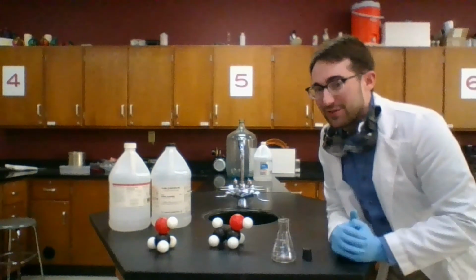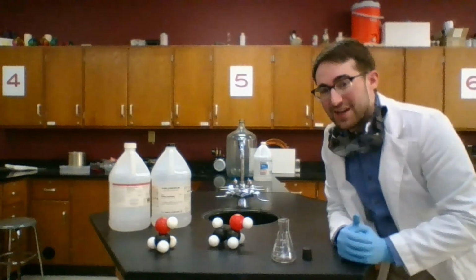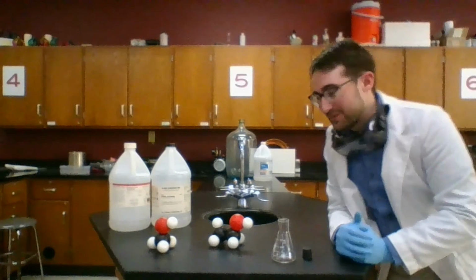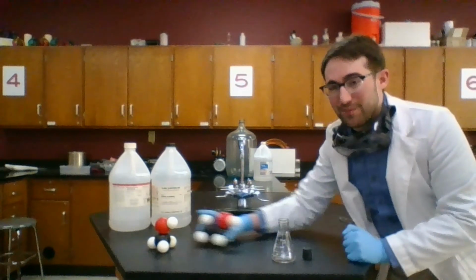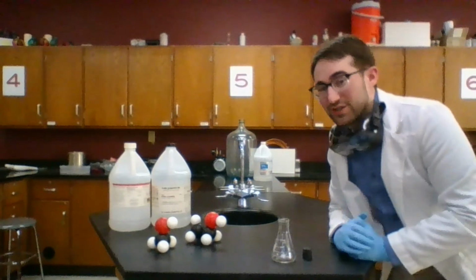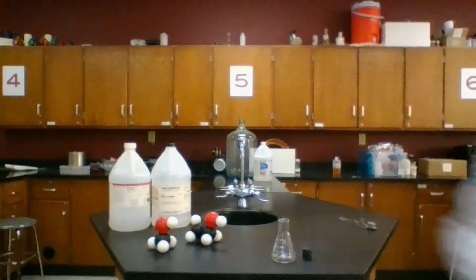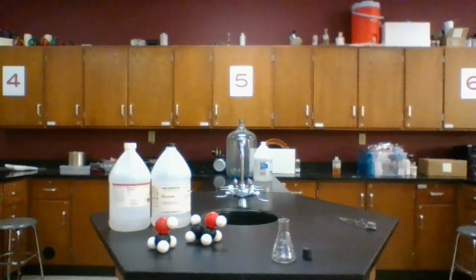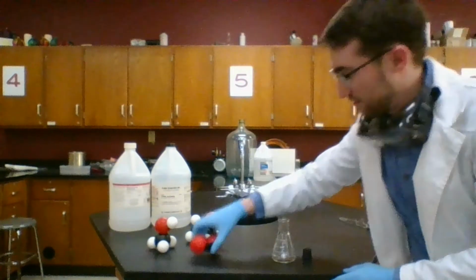Now, what they turn into can be predicted by the fact that this is a combustion reaction. So in our chemical reaction equation, whether we're using methanol or ethanol, both of these have C's and H's. They're going to react with O2, and they should make CO2 and H2O. This is our O2.